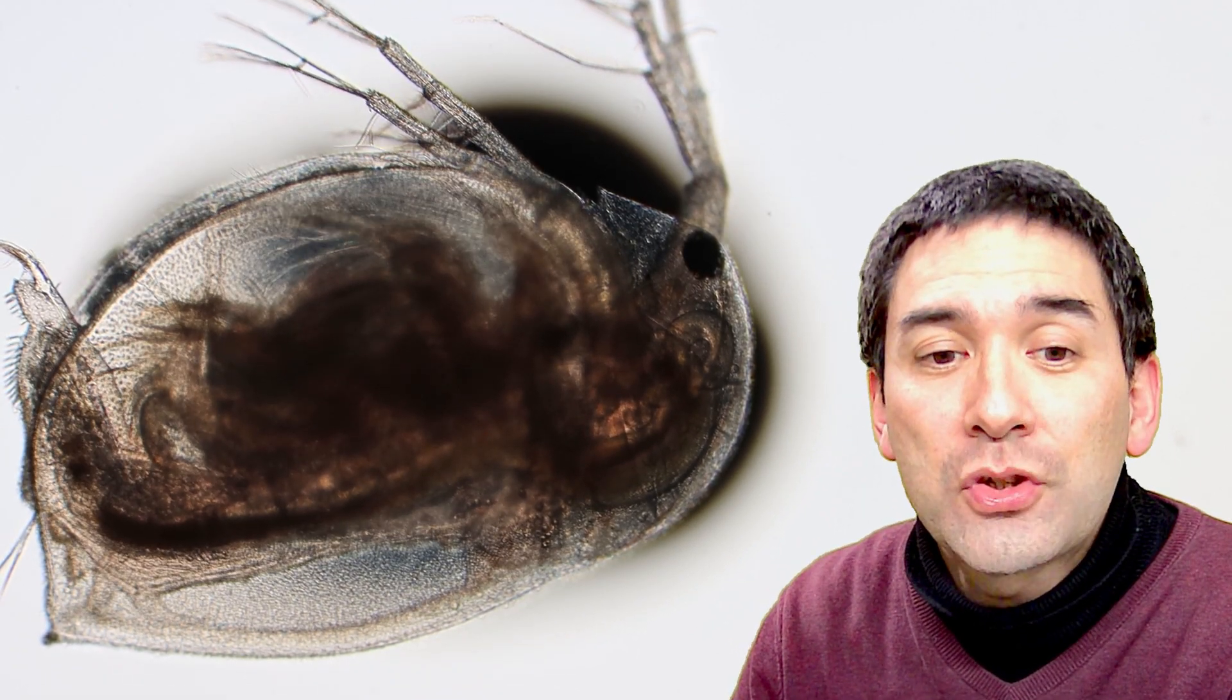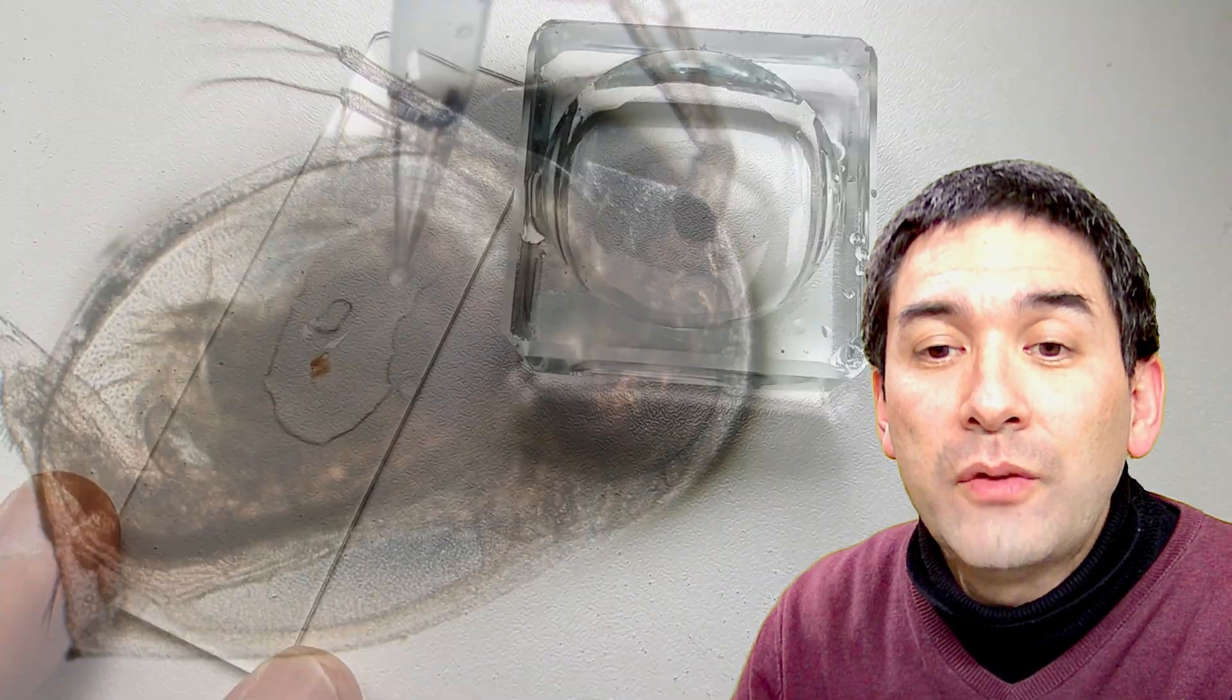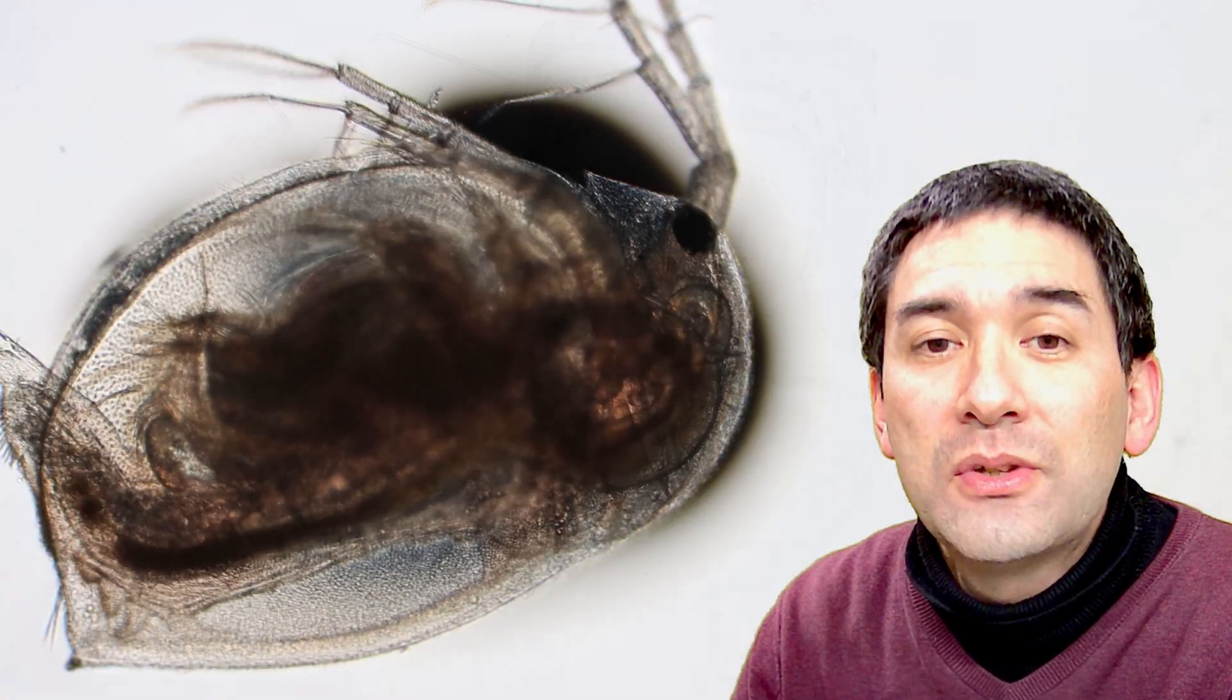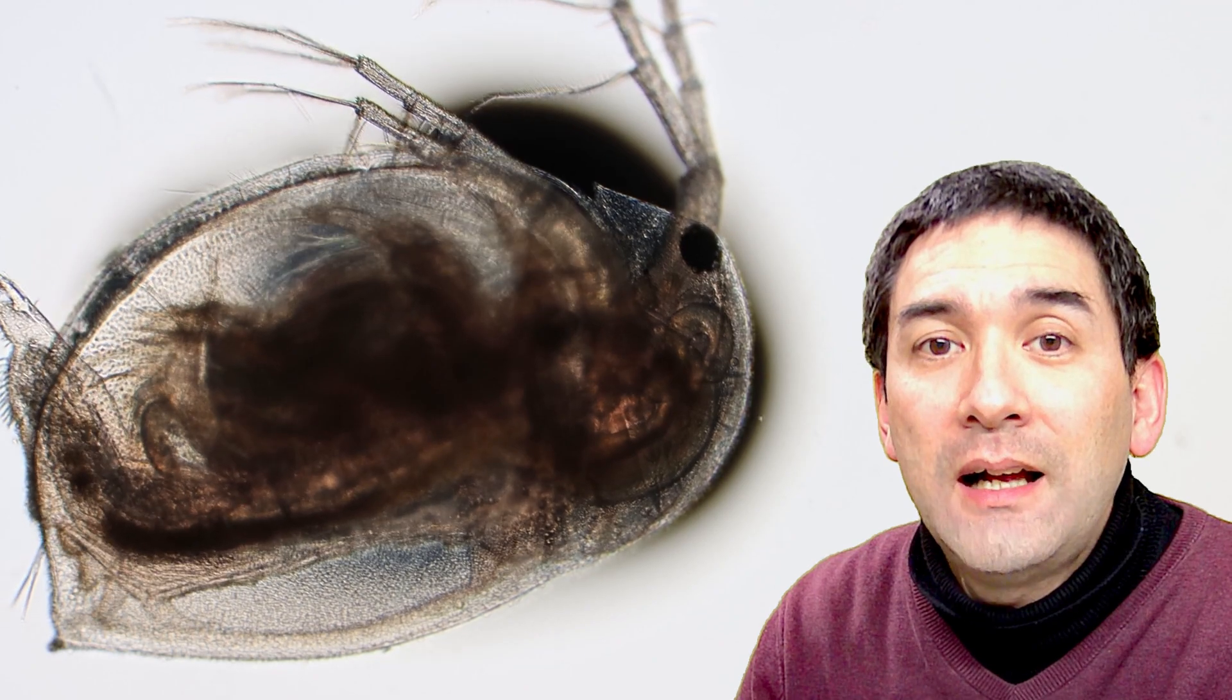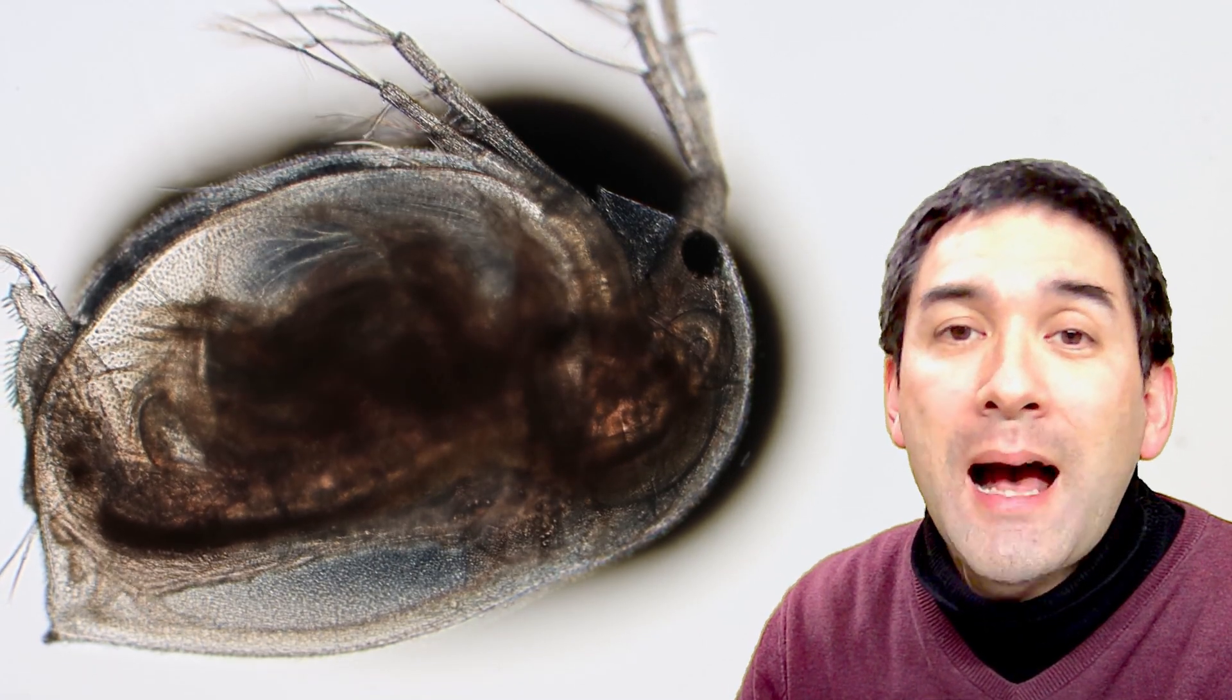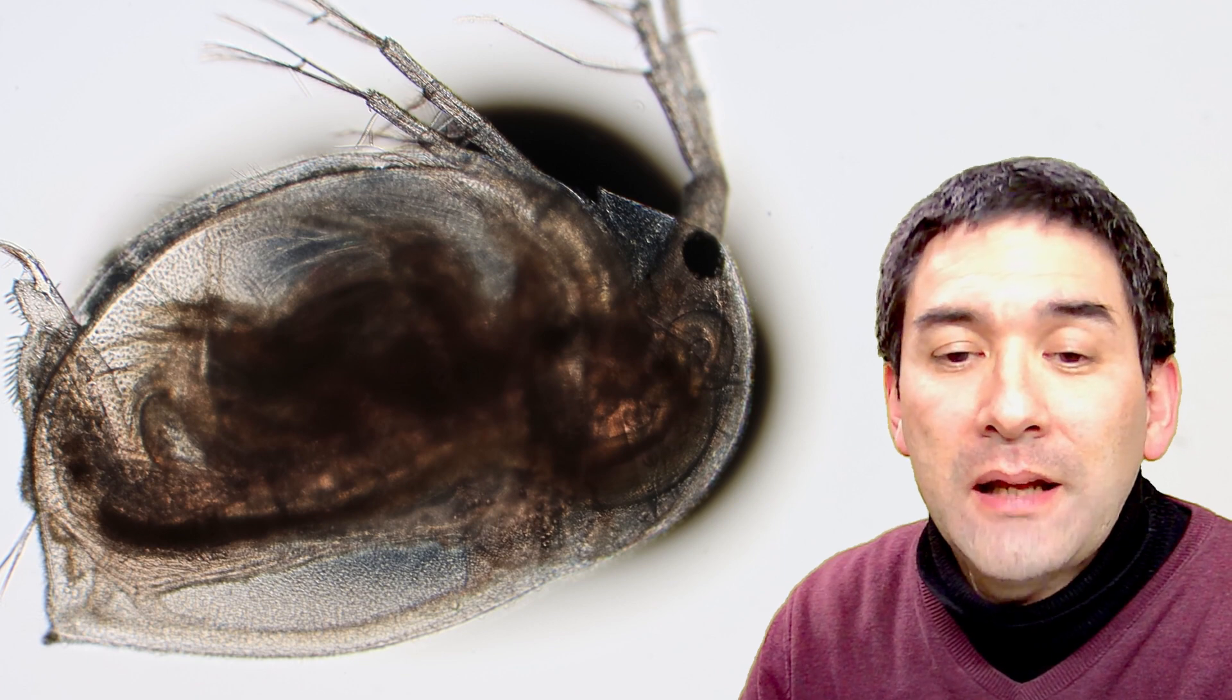So this was my pipette right now. Maybe I'm just going to show you again. Let's rewind this a little bit, so that you see what I've been doing here. So this is the Daphnia, and this little larger structure, this here is my pipette where I'm adding another drop.